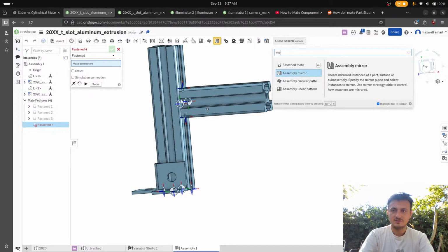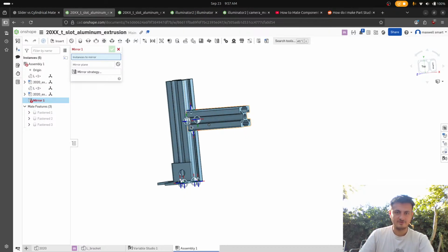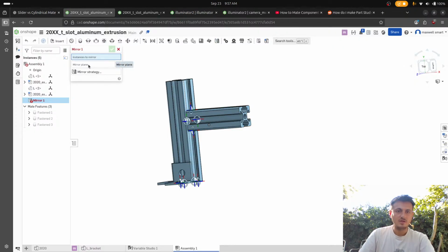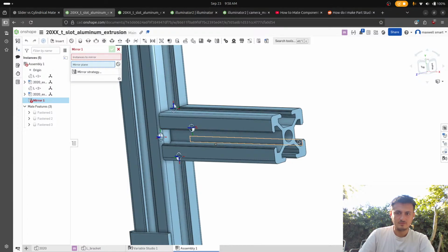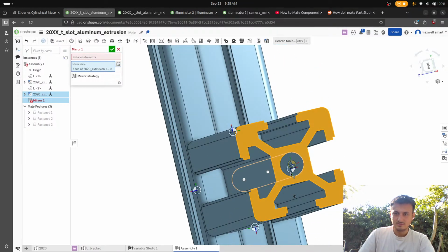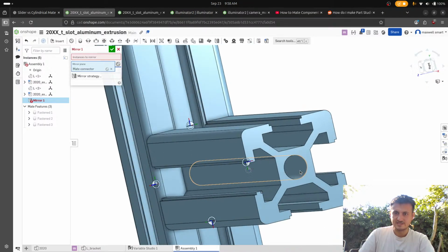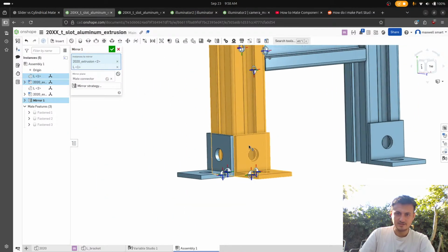Can we do a mirror on this thing? Assembly mirror? That's great. Let's try that. So wait, we need a mirror plane. So first off, can we get a plane? We can't get a plane, but we can do assembly mirror, mirror plane. How do I select a mirror plane? I want to be able to make a plane though. So there's this. Can I just offset it? I don't want that. Wait, but I can get that guy. That's the plane. I want that plane. And then we want to mirror this thing, and this thing.